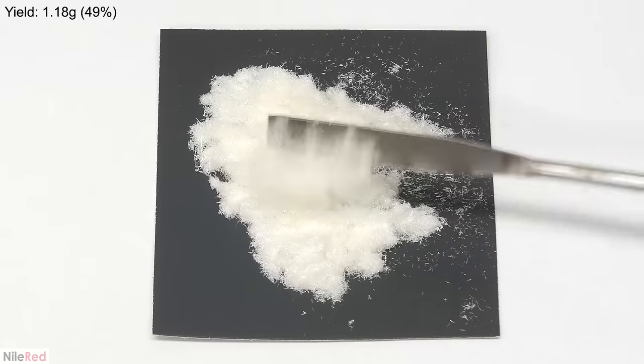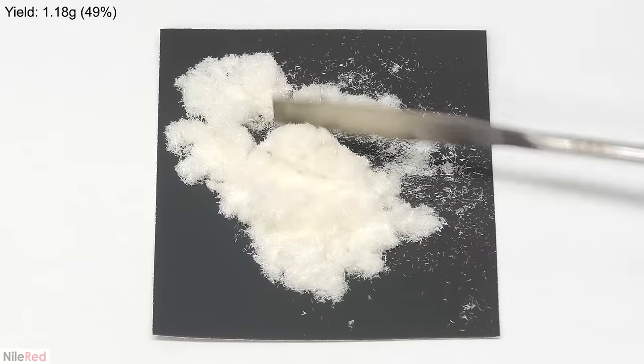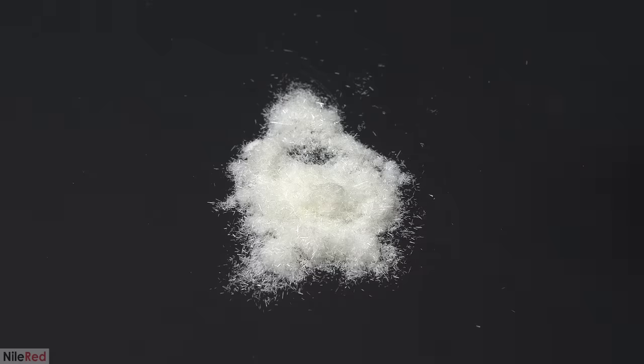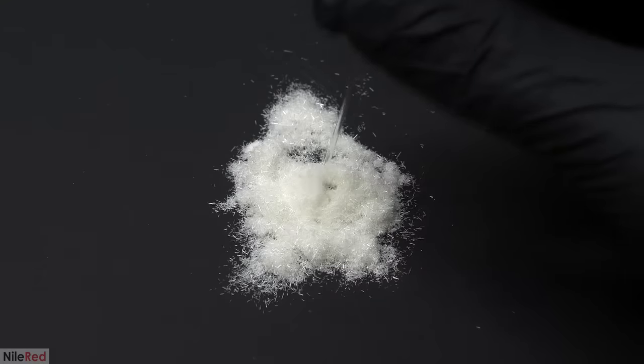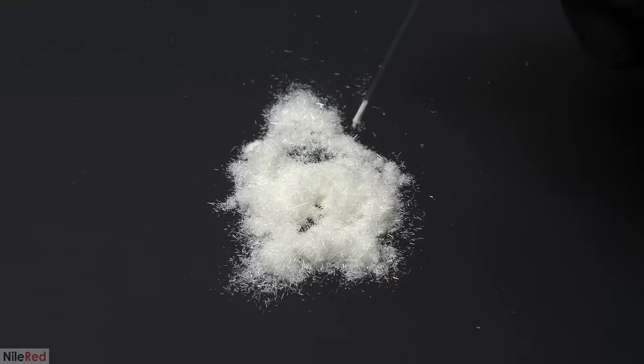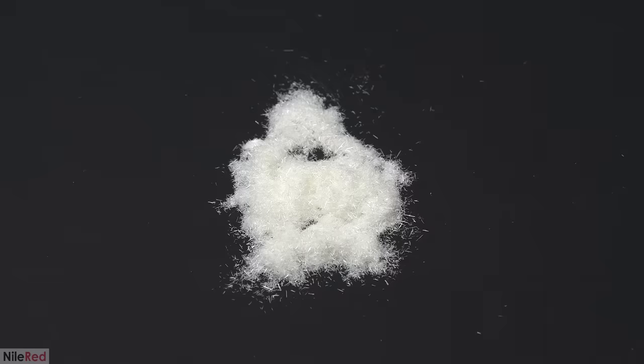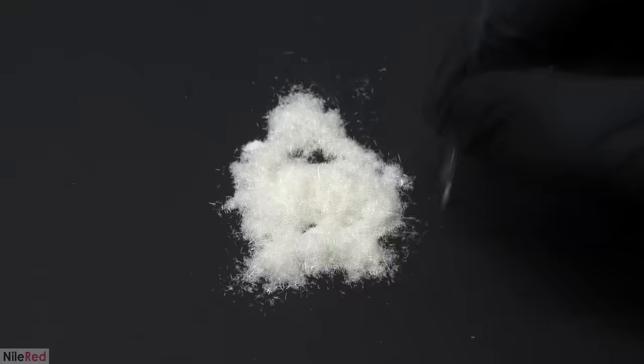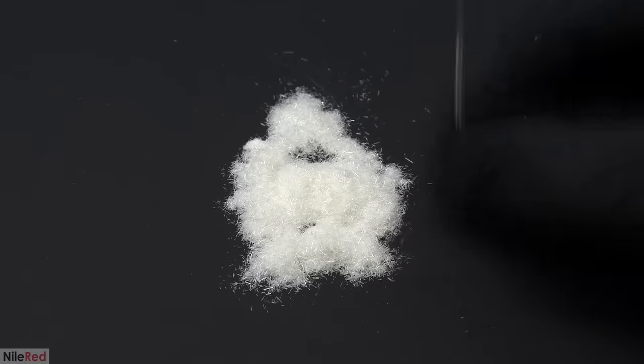My final yield here was 1.18 grams, which was a percent yield of about 49%. To confirm that this was, in fact, phenytoin, I took the melting point of it and compared it to the theoretical. It was extremely close, which told me that it was phenytoin and that it was relatively pure.